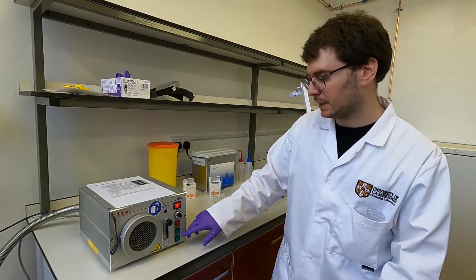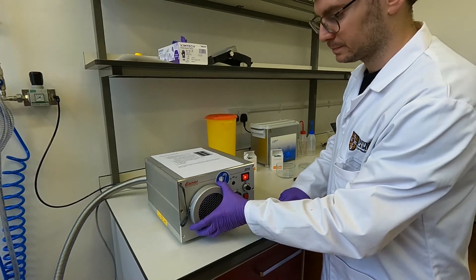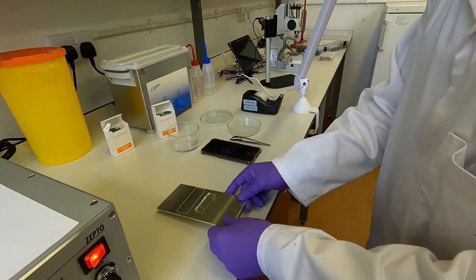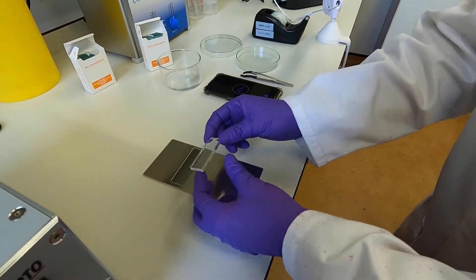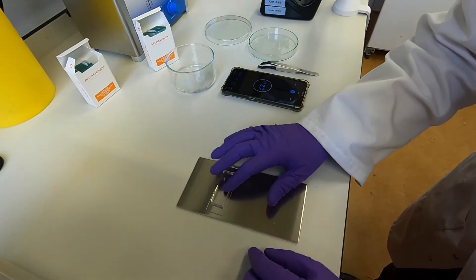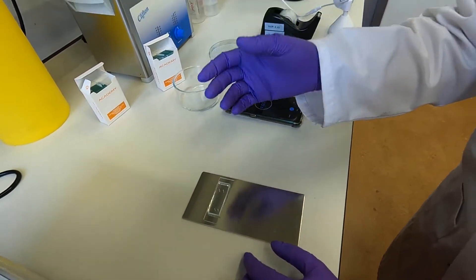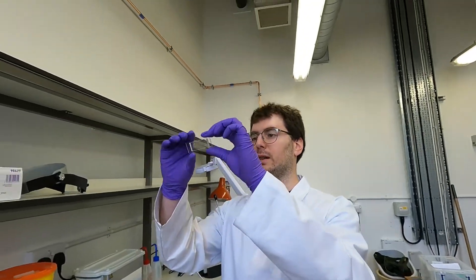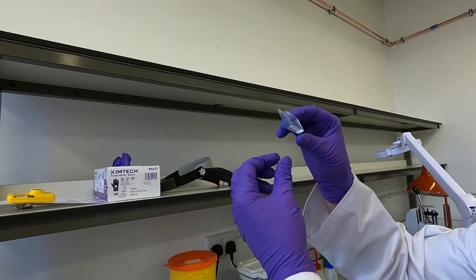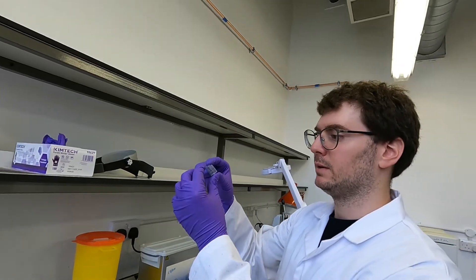I turn off the pump, close the valve for the gas, and turn on the ventilation to remove the samples. The final bonding step is to take out the plate and peel off the piece of PDMS — make sure you don't drop it at this point. Handle it very carefully and line it up with your substrate. Lean it on and gently tap it all the way around. Tap very gently because if your channels are very thin you risk collapsing them. If you see any bubbles or unbonded spots against a bright light, use one finger on one side of the glass slide to push against while gently tapping with your other hand to achieve relatively even adhesion throughout the whole sample.